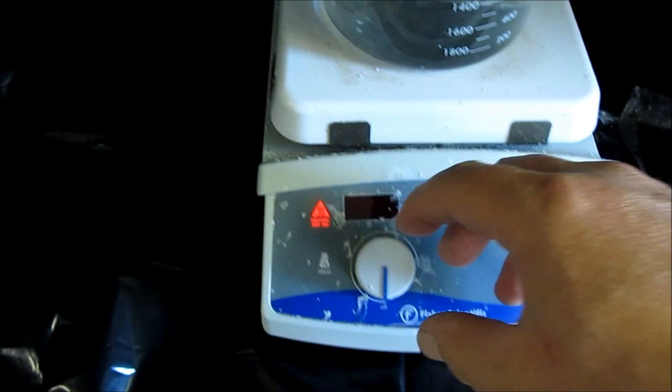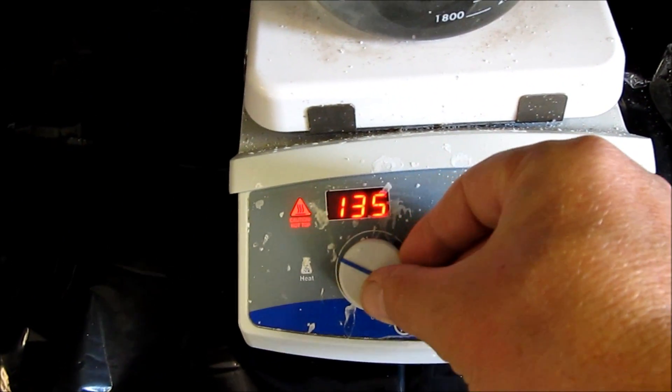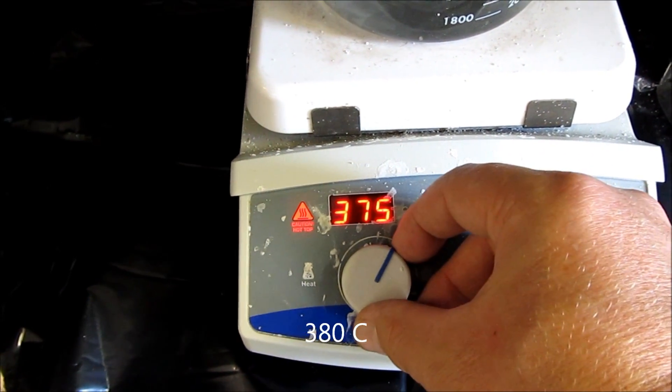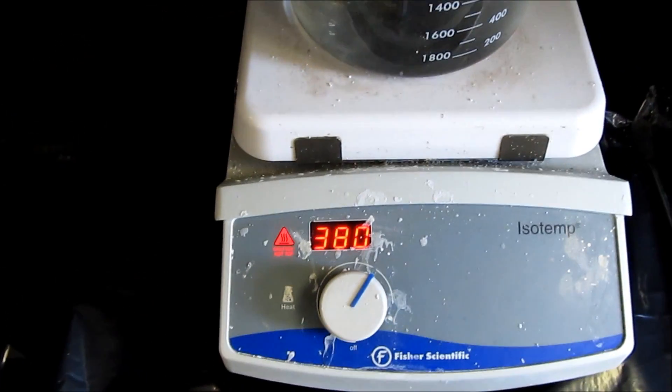Got to turn on my hood, don't want the fumes in here. Got a good lift of that. 160 degrees, 380. Temperature to start with.